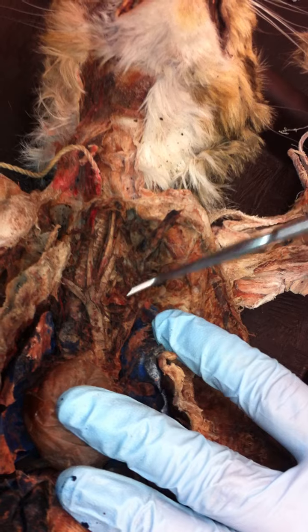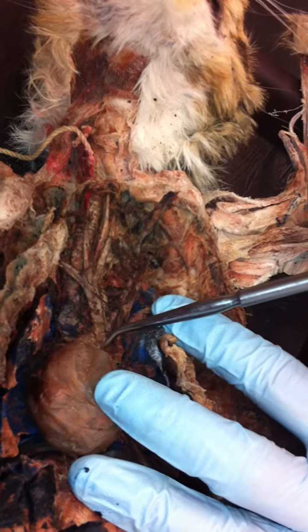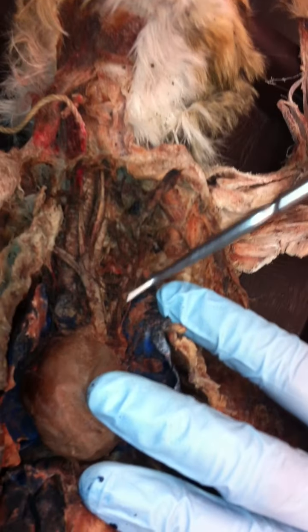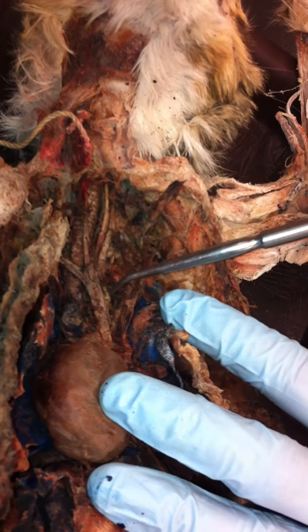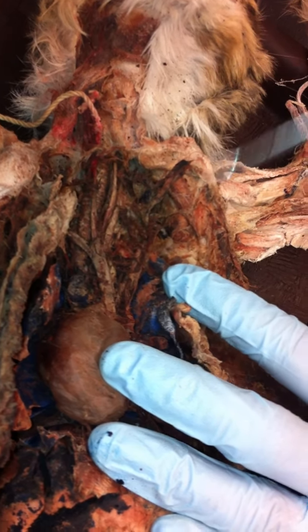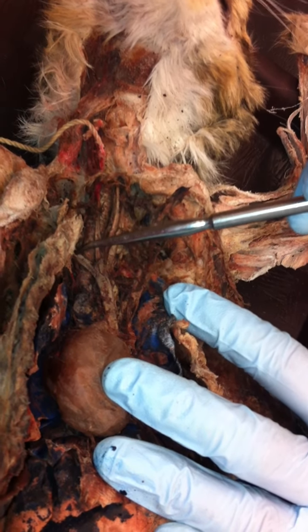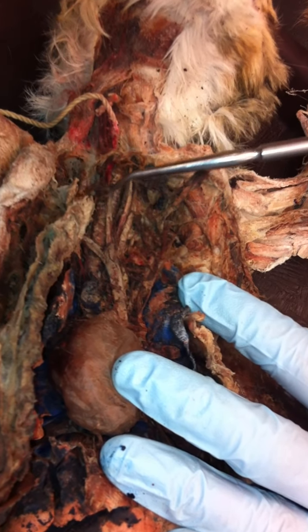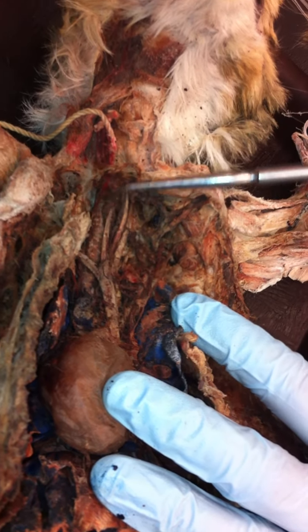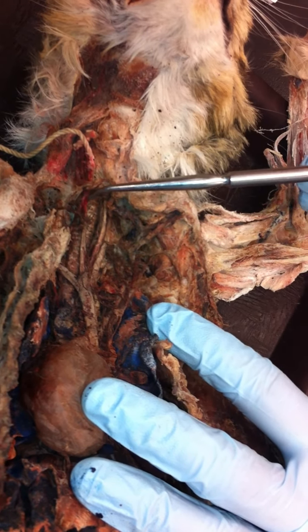you'll see the arteries. So the aorta is kind of tucked in right here, so it's hard to see. But then you have the first branch off, which is your brachiocephalic artery. There's only one brachiocephalic artery. Remember, there were two brachiocephalic veins. The brachiocephalic artery then goes to the right subclavian artery, right common carotid artery. Okay, so this is the arterial equivalent of the external jugular. Right? So this is the right common carotid.